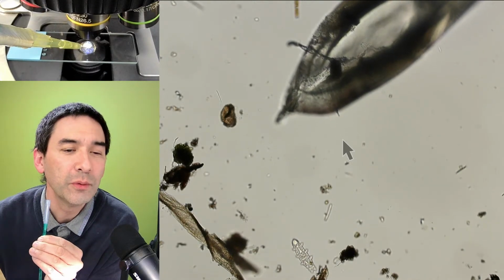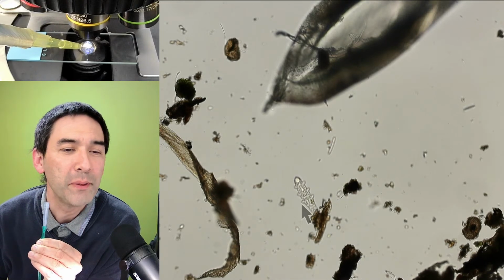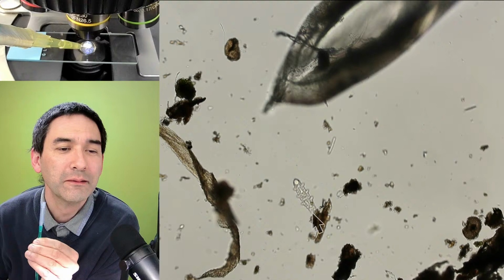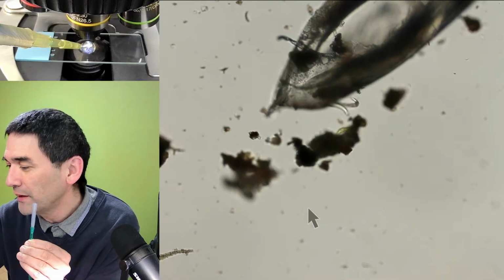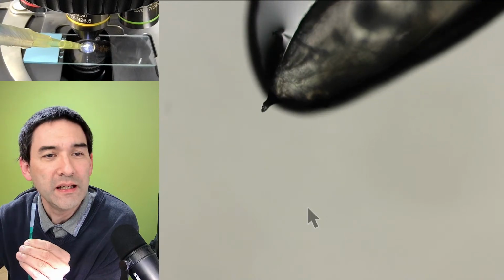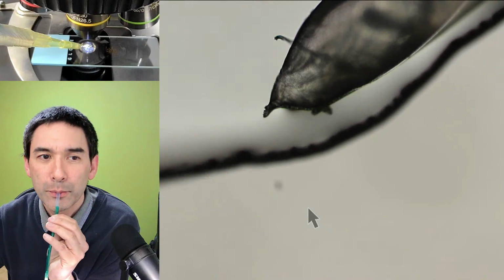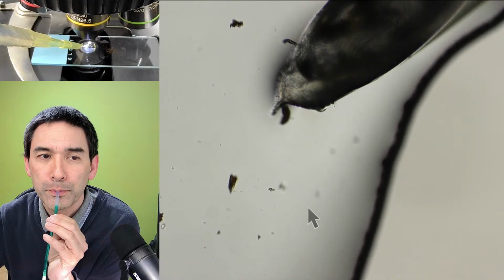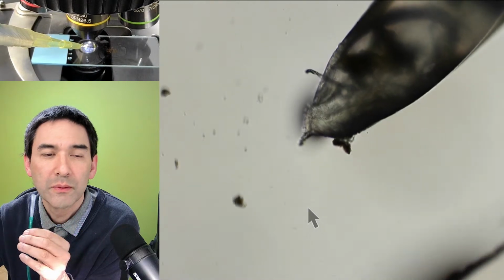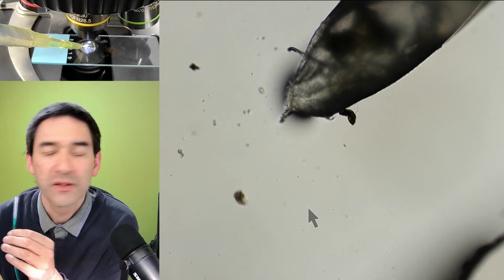Look at this down here. Do you know what this is? This looks like the skin of a water bear which molted. So this is basically the thing. Then I try to move over to a place where there is less water, and then I try to release it. Okay, is this the water bear? I don't know. Yeah, so that's kind of the idea.